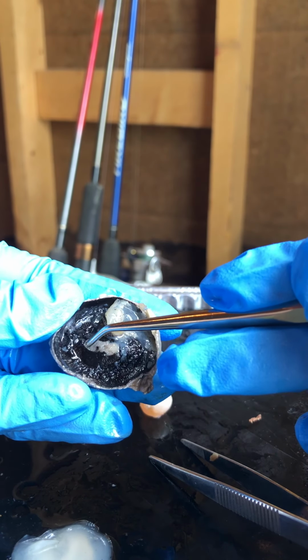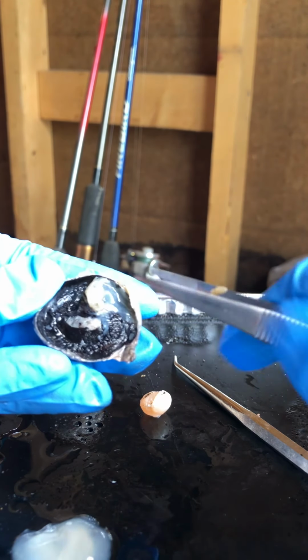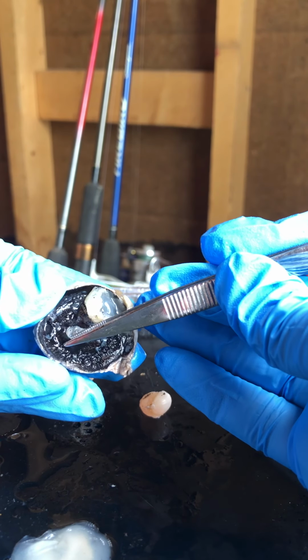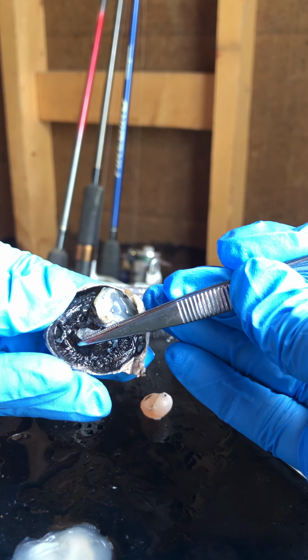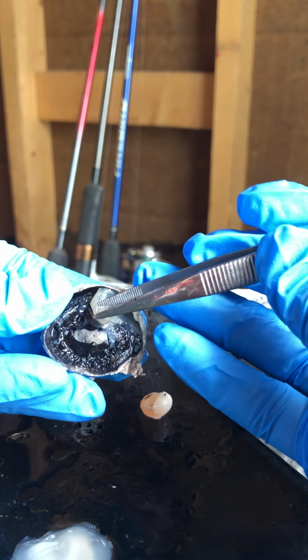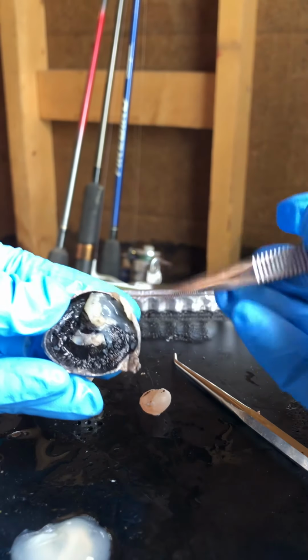Then underneath it is the iris. This is the iris, the black portion, the most anterior portion of the vascular tunic, and it contains pigmented cells. It is made of circular smooth muscle, and its function is to control the size of the pupil.